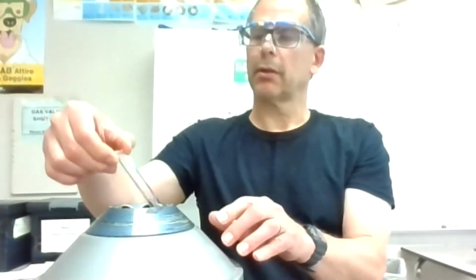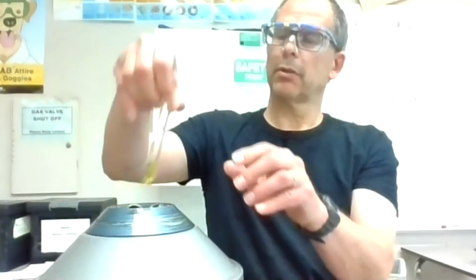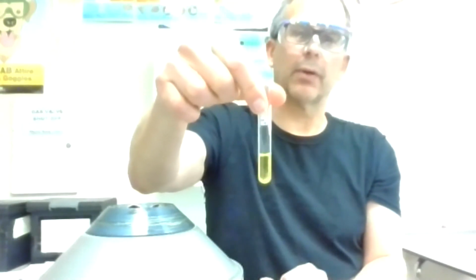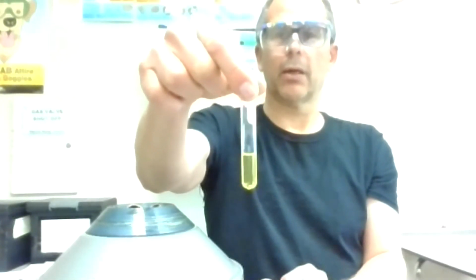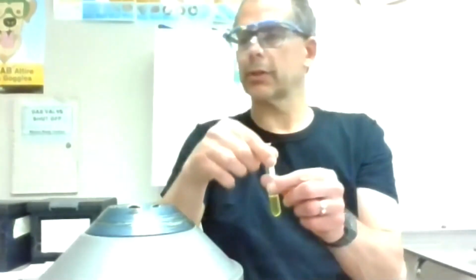And there's our clear solution, and there's yellow. I don't really see any precipitate formation, and it looks like I can see right through it. So I'm going to say there's nothing really reacting there. There's maybe a tiny trace of something on the bottom, but nothing frosting the glass and nothing significant. It could be a little carryover of that gel. So it does not look like we get precipitate formation in that third step.